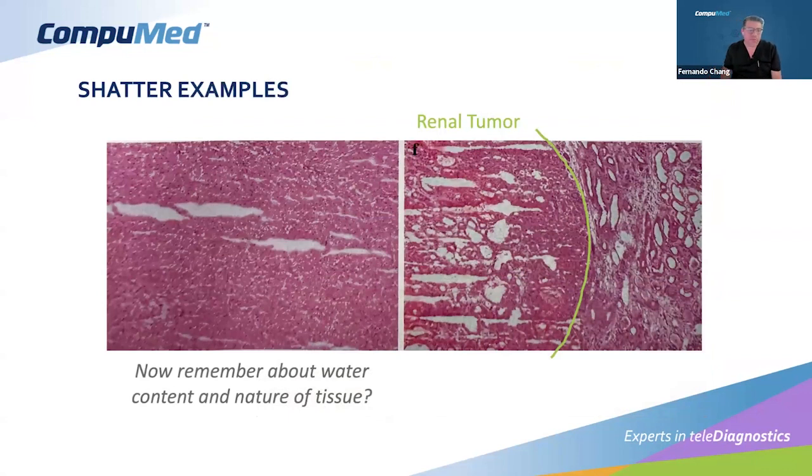And another thing that we have to remember is the consistency of tissue. So within the same tissue, let's say in this case a renal tumor, actually kidney, and this kidney happened to have a renal mass, a cancer mass. So it's the same tissue. We're cutting at the same temperature, but you can see on the right here how these tubular structures and the kidney itself, the parenchyma, doesn't have any shatter. It's actually the perfect temperature. But then you can see on the left that the same case, with the same temperature and everything, is creating the shatter.